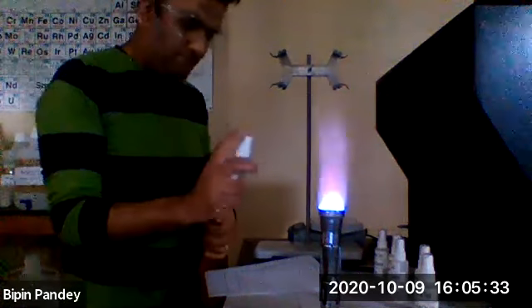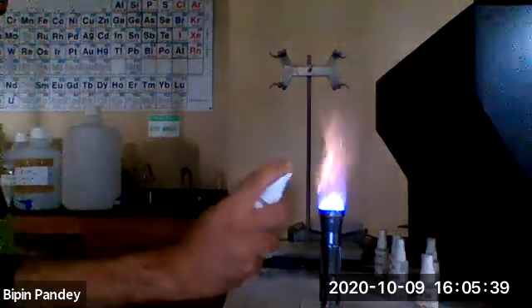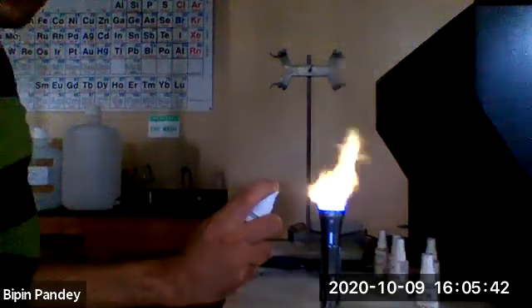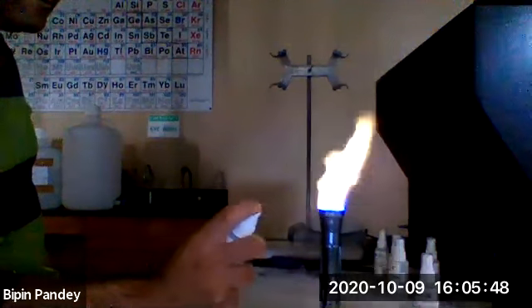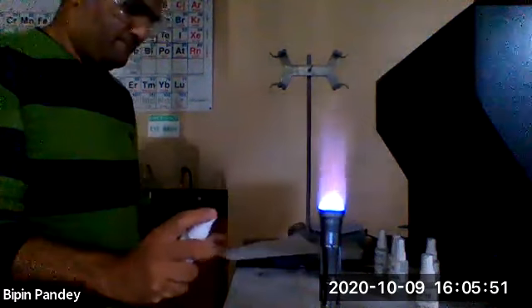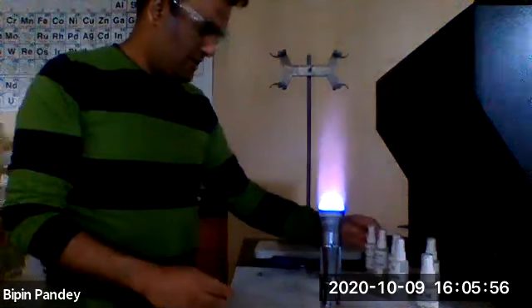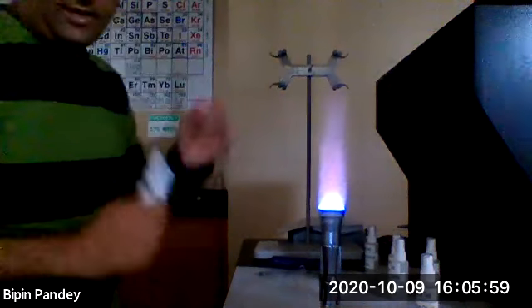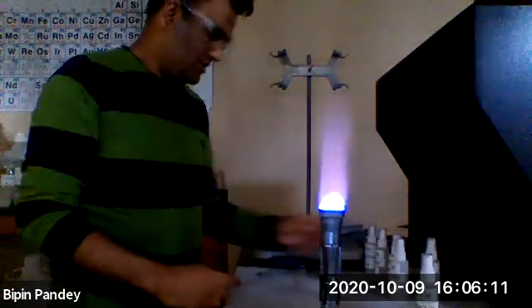I have the barium. This is the barium. Next one I'll do is calcium. Third one I have is lithium.